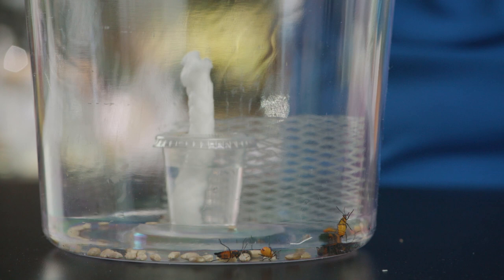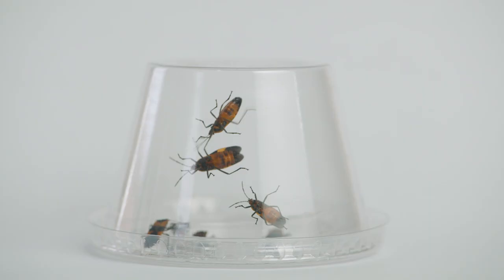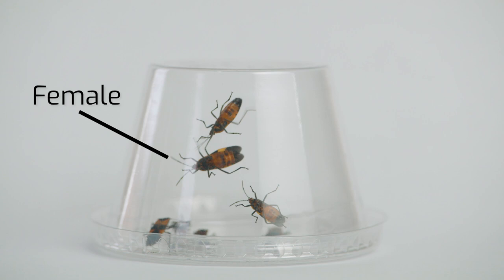If you need to determine the sex of the milkweed bug, this can be accomplished quite easily in adults. Females tend to be larger and have black spotting on the underside of their abdomens. Adult males are smaller than the female and are characterized by thick black banding on the underside of their abdomen.